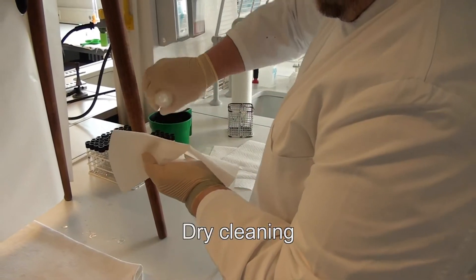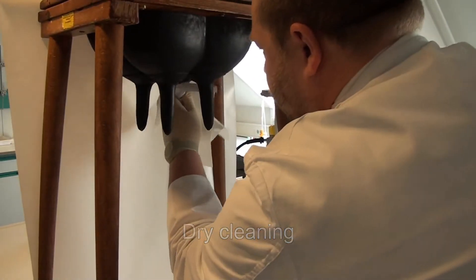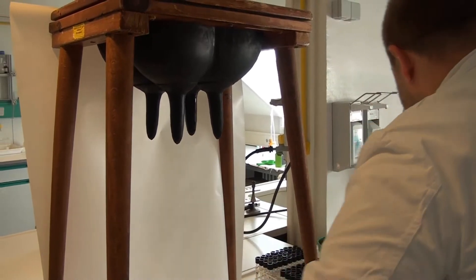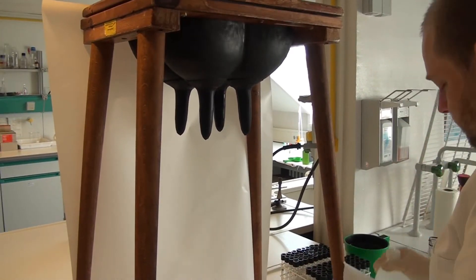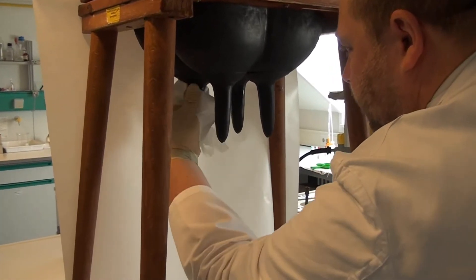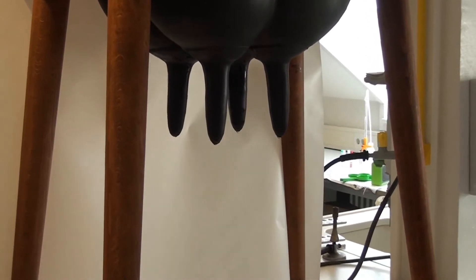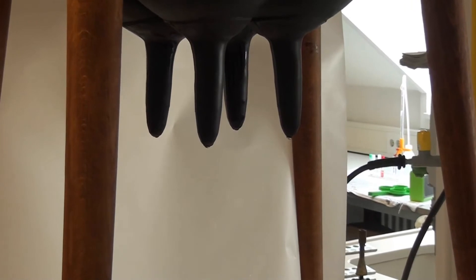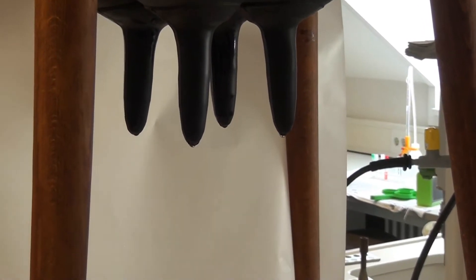If possible, teats should be cleaned in a dry way, and although alcohol is used here, cleaning is still considered dry as the alcohol evaporates quickly. During this step, paper towels are soaked with alcohol and teats swept clean. Eventually, more towels per teat have to be used.